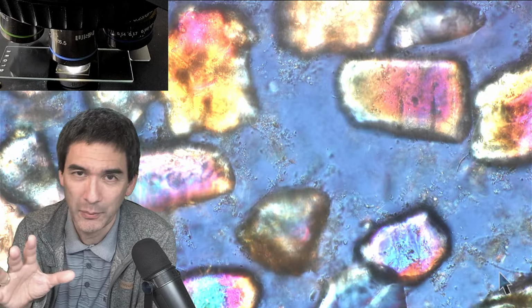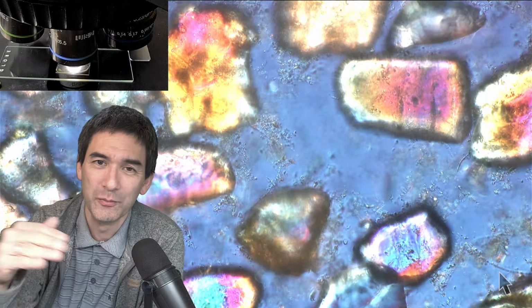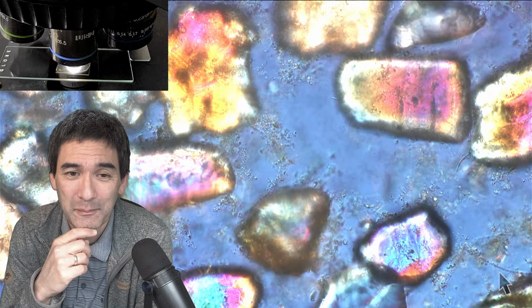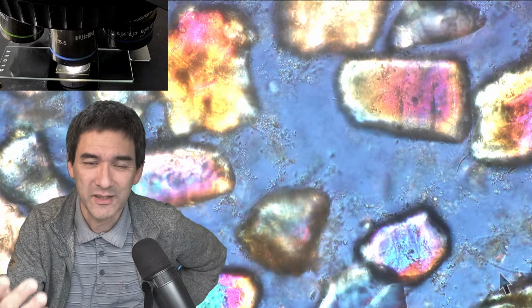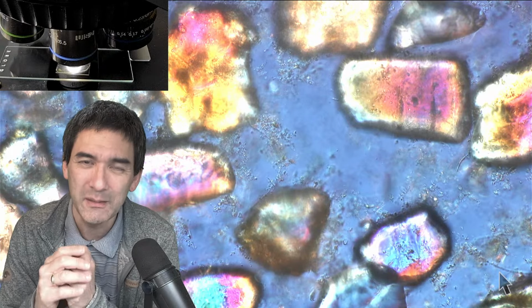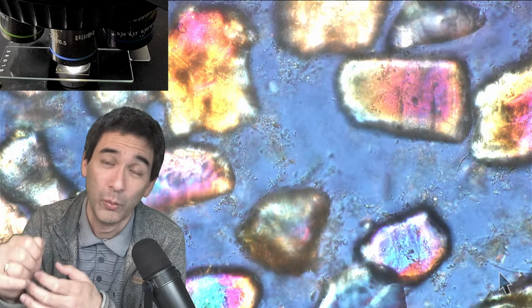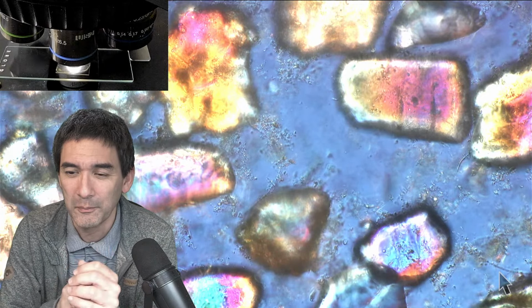I used a sample with nematode worms. The problem is that they were always moving in and out of the field of view. Sometimes for several minutes, you could not see any at all. Most of the time it looked like this, no movement, and every couple of minutes you could see some movement. So in that sense, it was a little bit boring, but that can be solved. The bigger problem was that the water evaporated, and therefore I had to add more water every 30 minutes or so. So this is a little bit the problem.